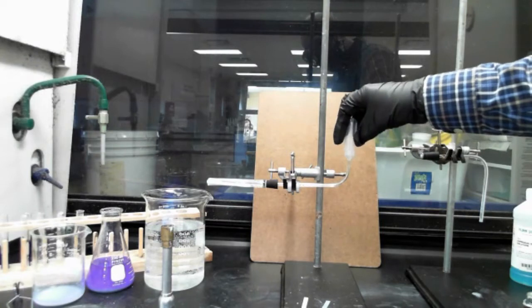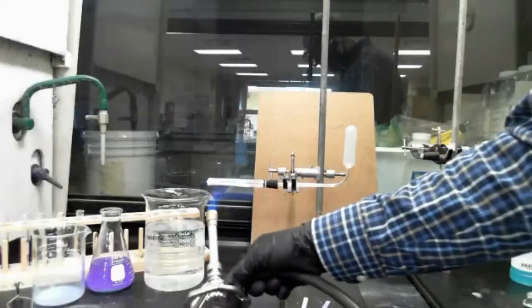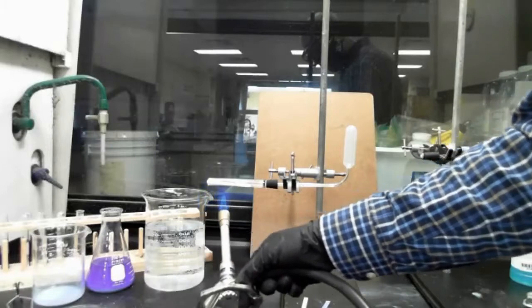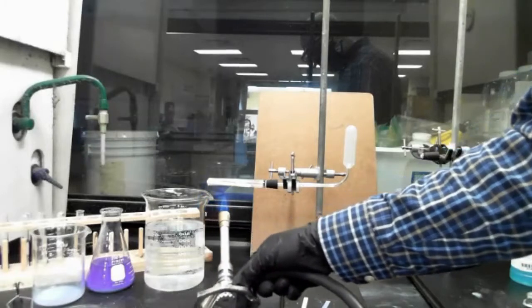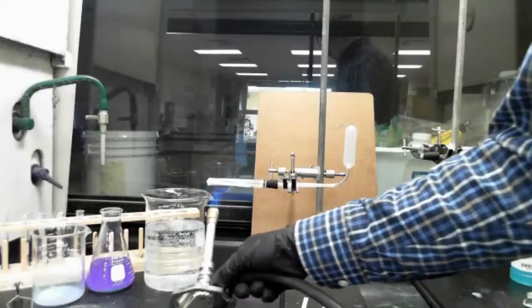I'm going to collect some more here, see if this has enough reaction left in it. I'm generating some more water in there, so it does, I hope.